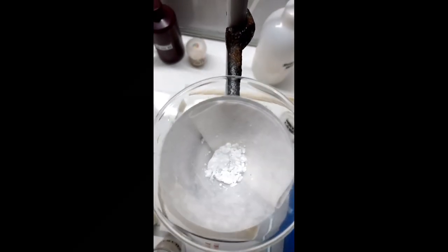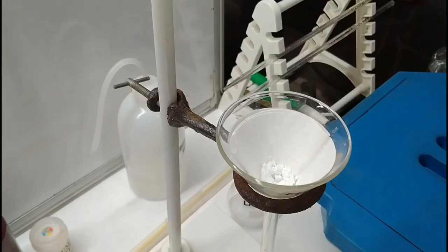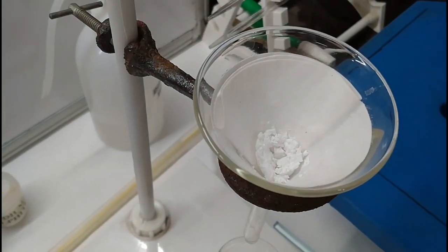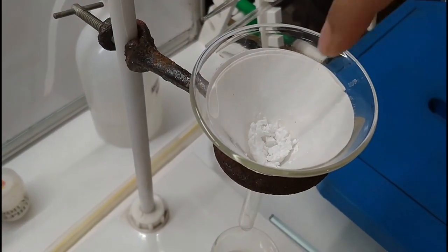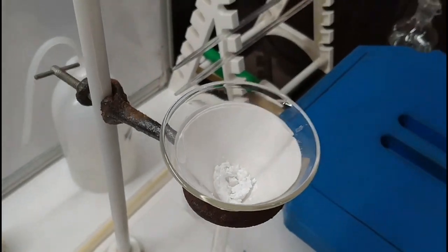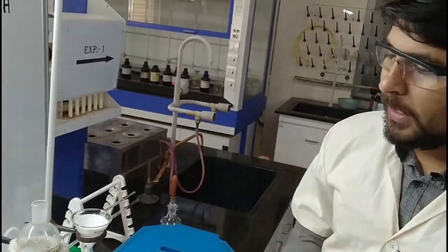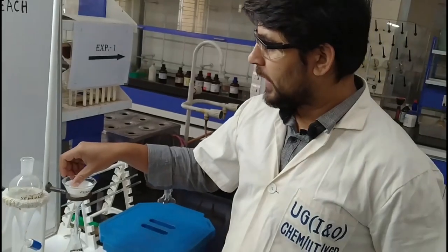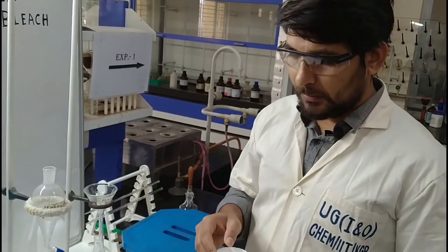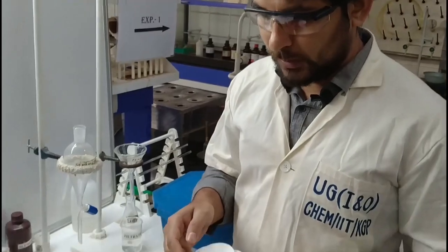This is the benzoic acid gathered at the center of the funnel. Students, you can see all the prepared benzoic acid gathered at the center of the filter paper of the cone. Our next work is to remove this from the funnel, then dry it, and then take the weight of the prepared benzoic acid.